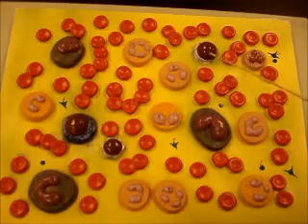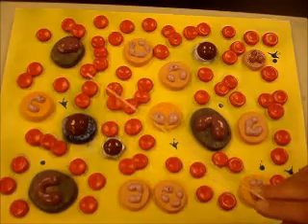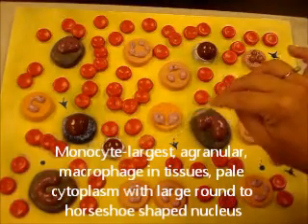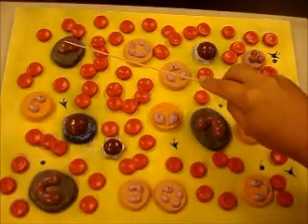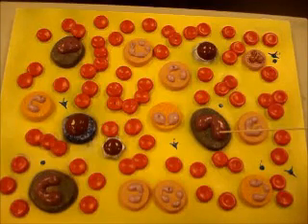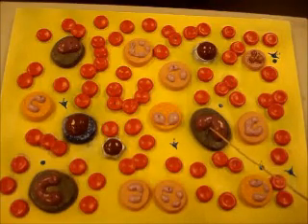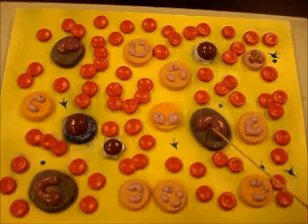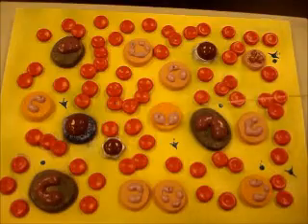Then we have our two agranulocytes, which usually have a very light staining cytoplasm because their granules are tiny and don't really show up when stained. The monocyte is the big one — its cytoplasm will look pale on the microscope. The nucleus of a monocyte is usually round, horseshoe shaped, or kidney bean shaped, and it's large, but you'll see a lot of cytoplasm in these cells. Monocytes specialize in becoming macrophages out in the tissue. They leave the plasma, migrate to tissues like the liver, lungs, and skin, and wait for pathogens. Once they eat a pathogen, they trigger an immune response.